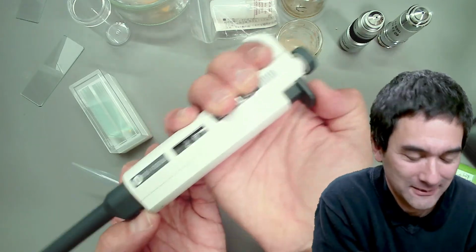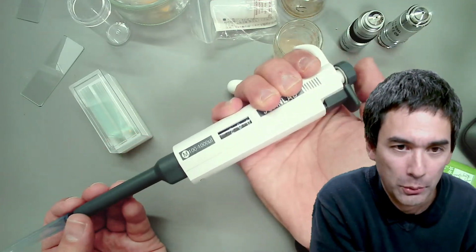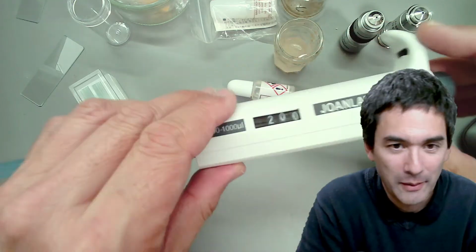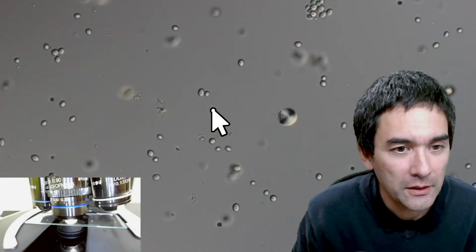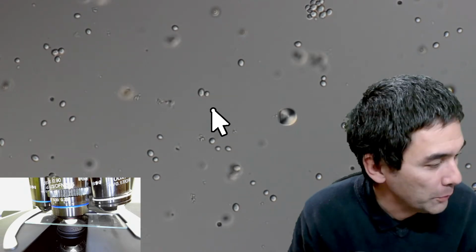Oh, look at this. And with this one, you're actually able to draw in the liquid. That's why it only cost a tenth of the price that it normally would cost. So these are basically the yeast cells. Let's have a look at it under the microscope again.